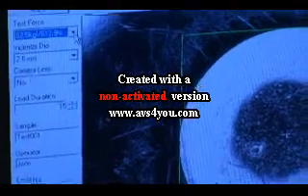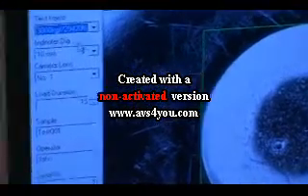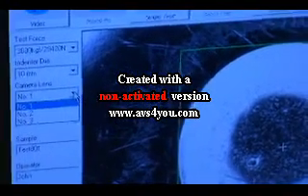Here at 2.5, you can buy additional lenses to do very small indentations. It's not needed for your standard application, but if you do, the camera lens down there says number one right now. You change that to number two or three depending on the additional lens you order.